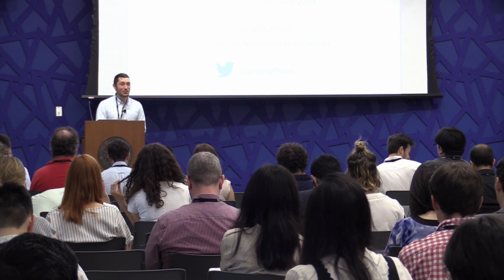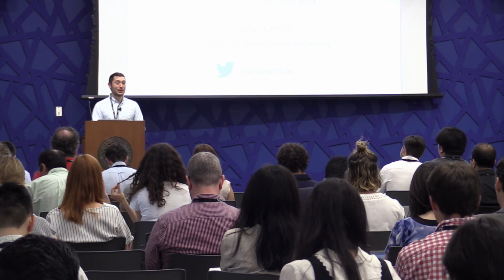So I want to welcome everyone back from their coffee break. We're going to be on the third workshop in today's workshop series. We'll be looking at optimizing your LC-MS system using a software platform that we developed in the Slavov lab entitled DoMS. And DoMS stands for Data-Driven Optimization of Mass-Spec Methods.